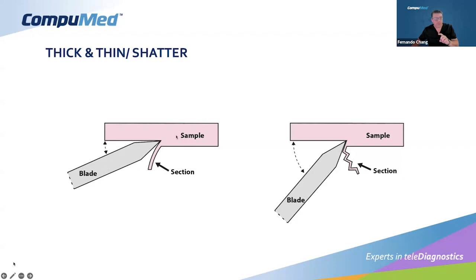This is the tissue, also embedded in OCT, two consistencies, remember. It gives you a section that is more like a uniform shaving, a very delicate shaving, as you can see, remember, in the pictures and the videos, how it shaves immediately. And this is 5 microns, which, just to remind you, is a millimeter divided by 1,000. This is the thickness we are cutting.